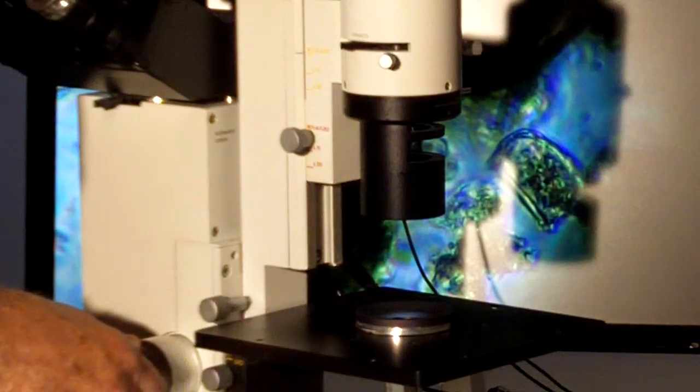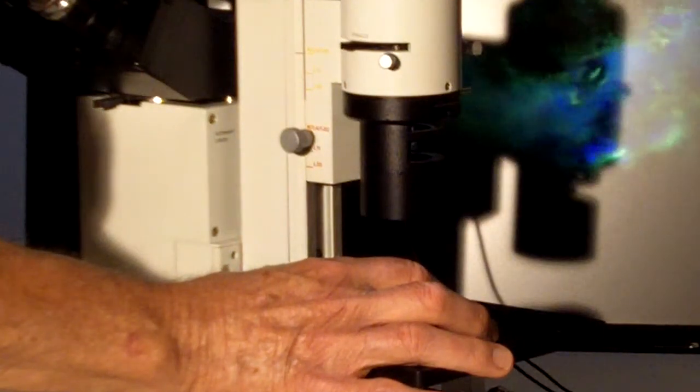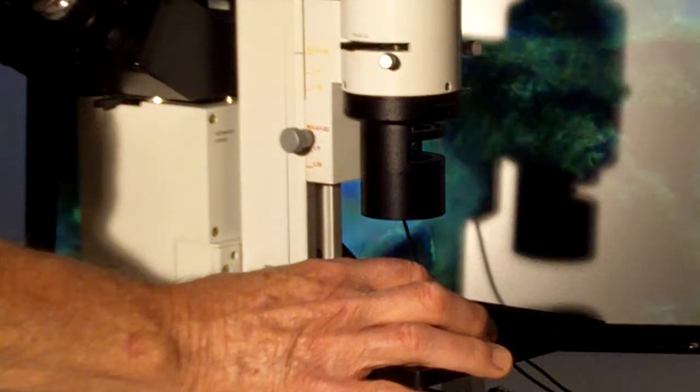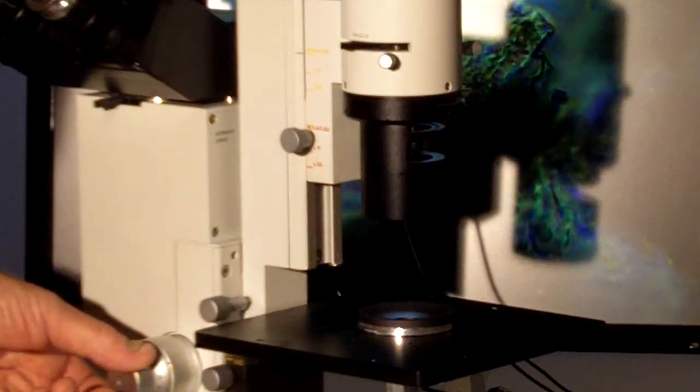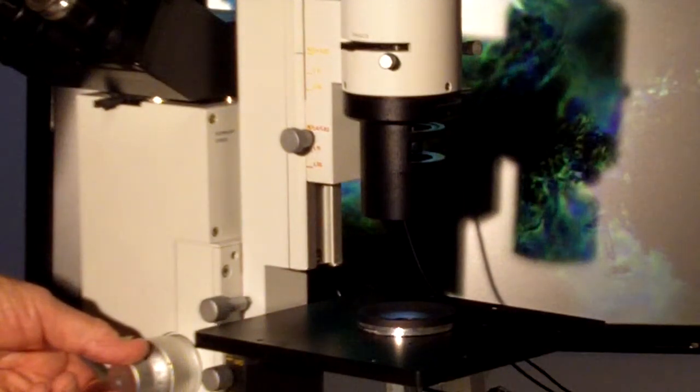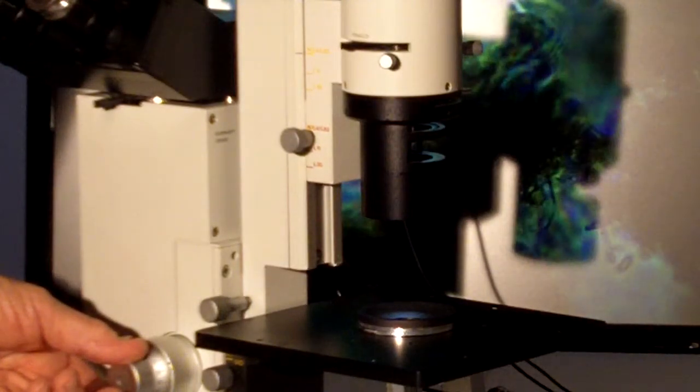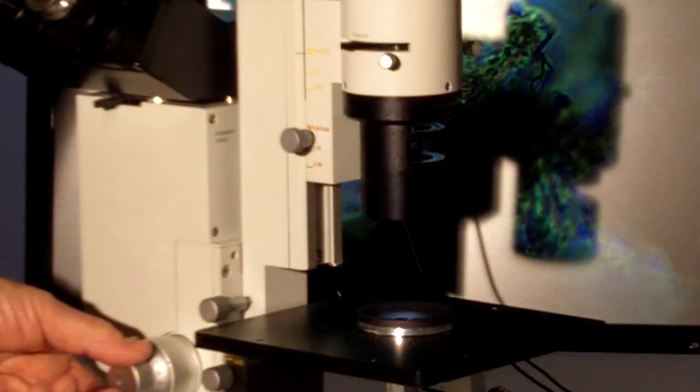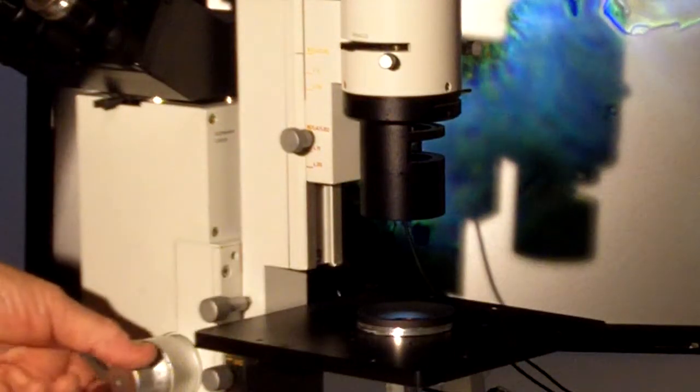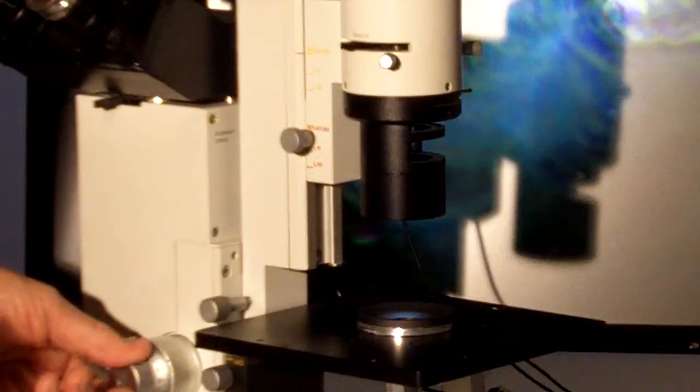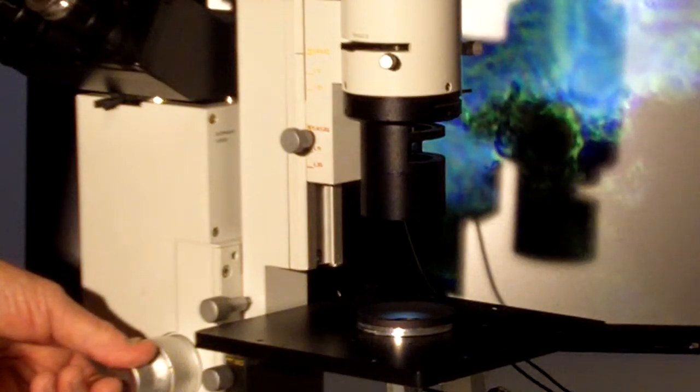Now we have a nice flat bottom. The moment we start looking at small structures in phase contrast we start seeing some things. If we're lucky we'll catch some guys swimming around here. This is just a fresh sample of pond water I took this morning and students can spend hours with this just looking to see what they've collected in the pond water.